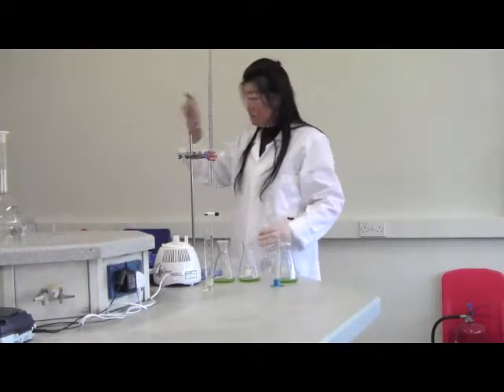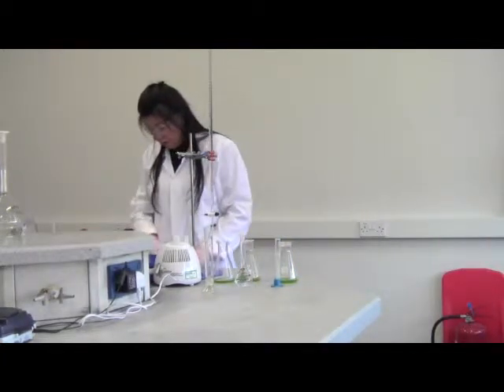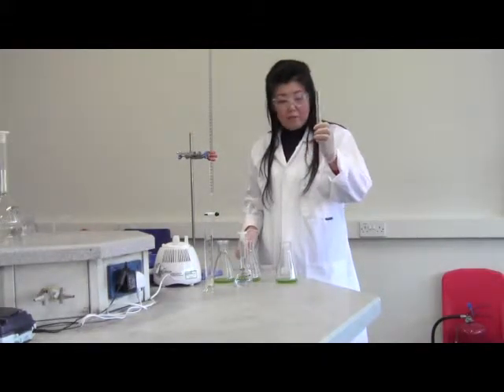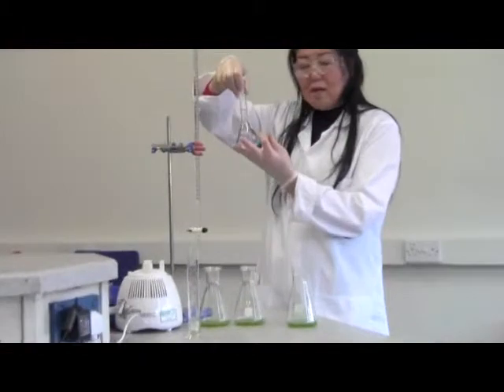So I'm going to use the reaction board to show you the chemical reaction formula. That way, we need 5 milliliter of 0.06 mole potassium iodide.